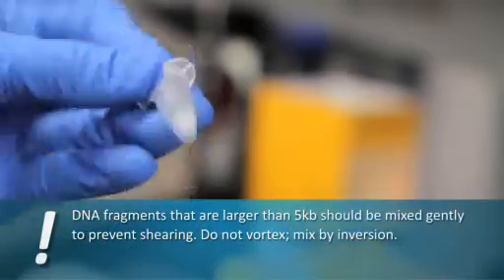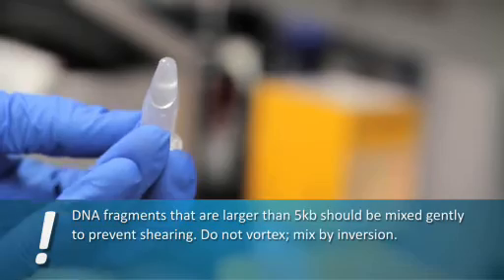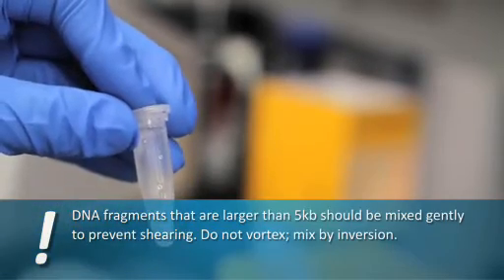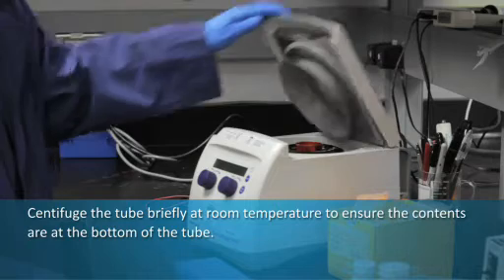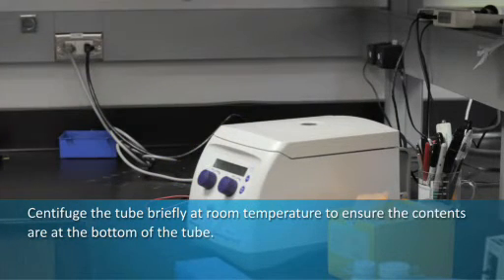DNA fragments that are larger than 5 kilobases should be mixed gently to prevent shearing. Do not vortex. Mix by inversion. Centrifuge the tube briefly at room temperature to ensure the contents are at the bottom of the tube.